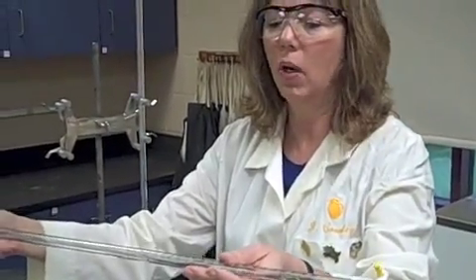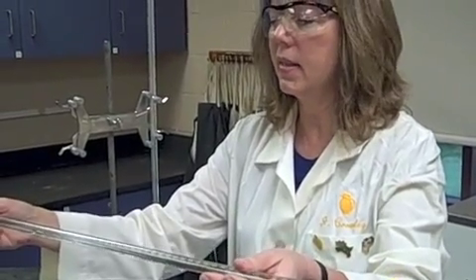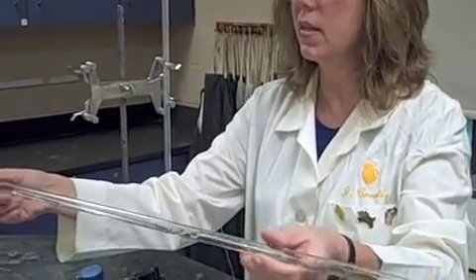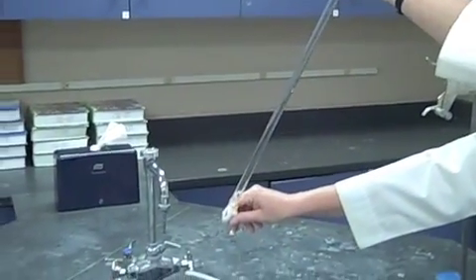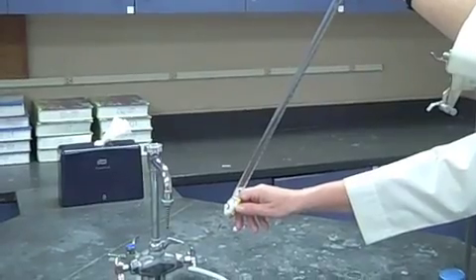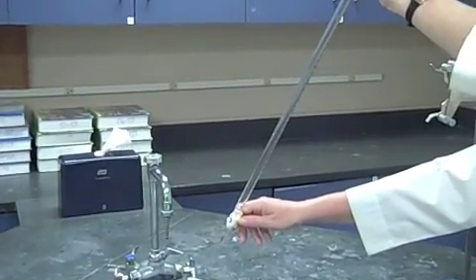So you want to, as quickly as possible, swirl that acid and coat the inside of your burett. And then of course you want to let it out at the tip because anything that might have been in that tip is going to affect your results.